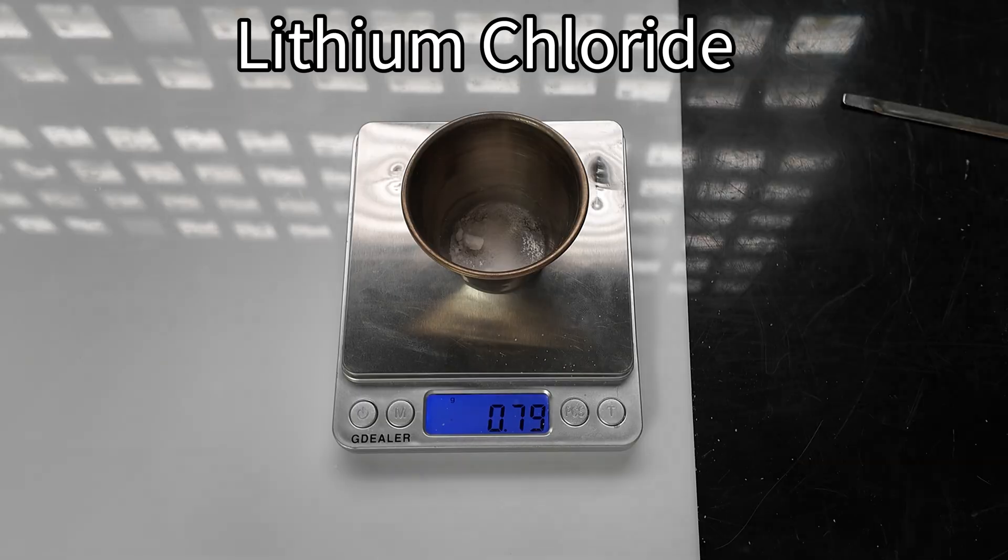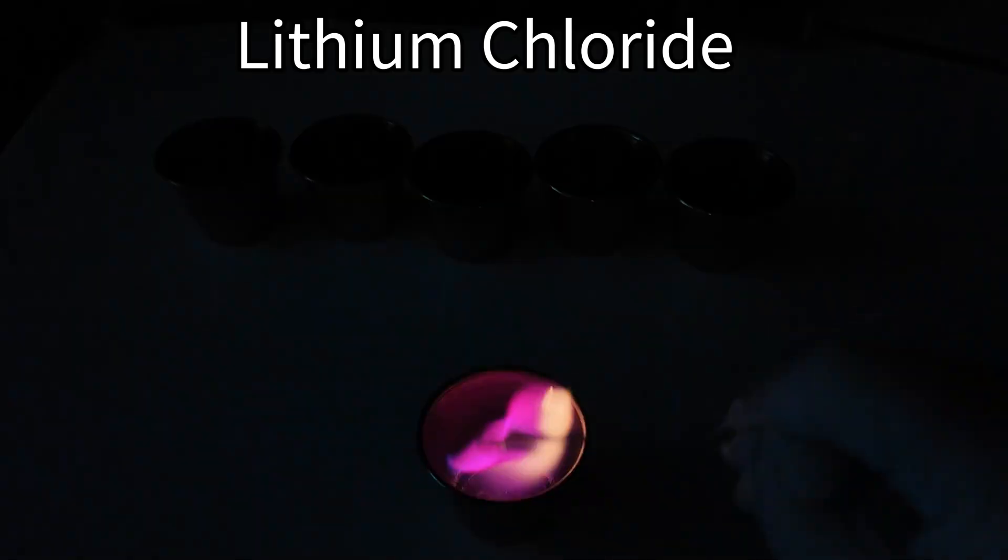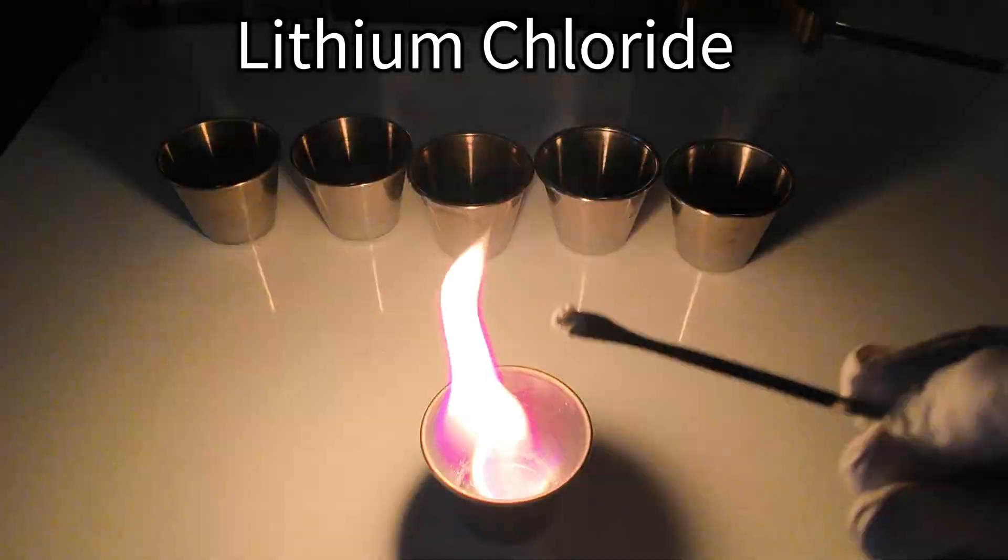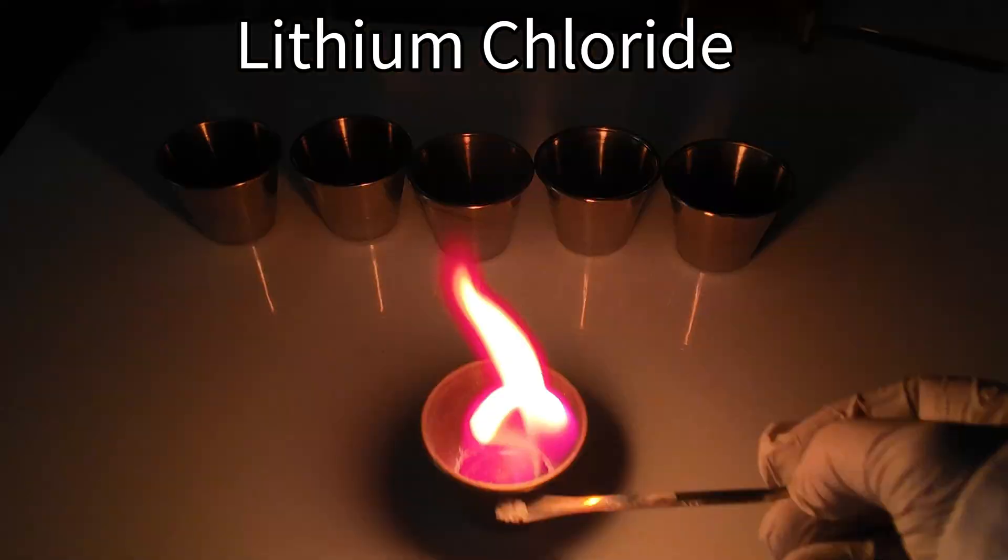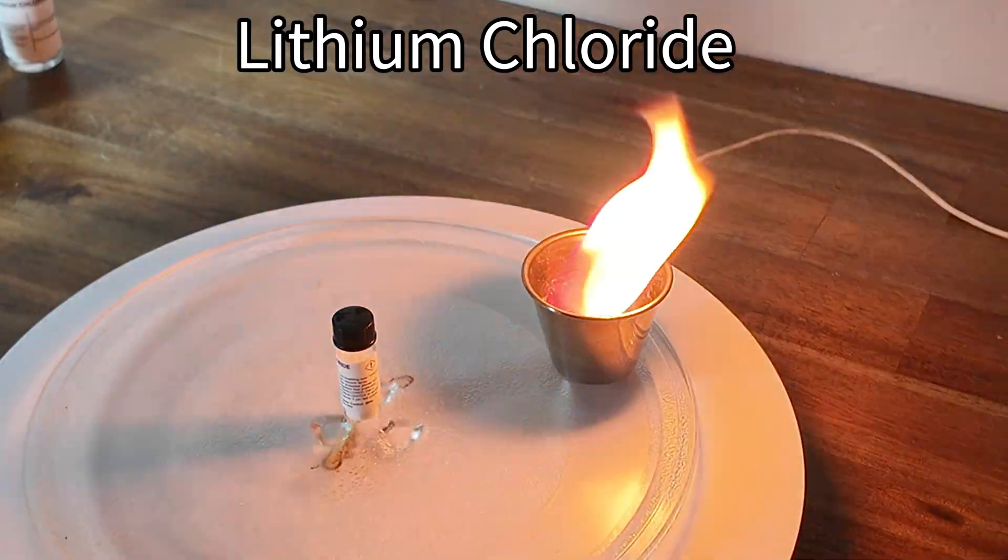Next up, we have lithium chloride. As you can see, when the lithium chloride is heated, it gives off this deep crimson-red flame. Similar to strontium, but a little bit different.